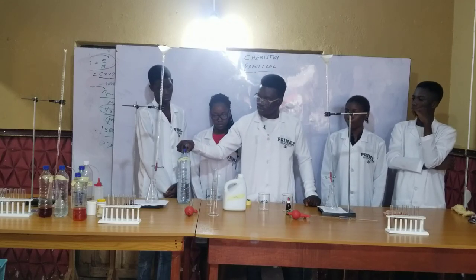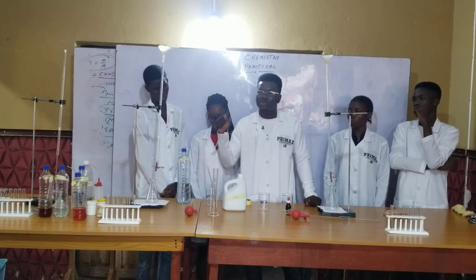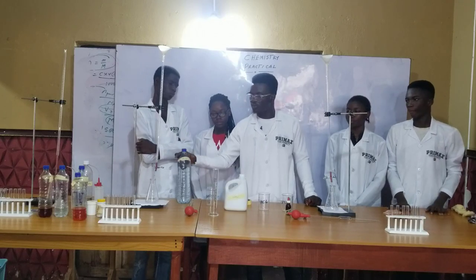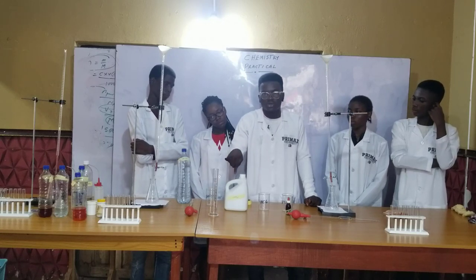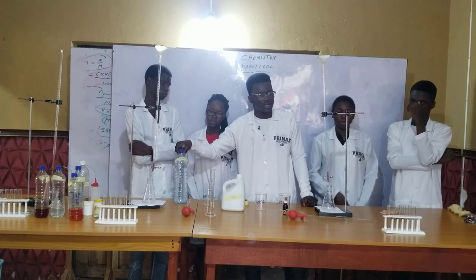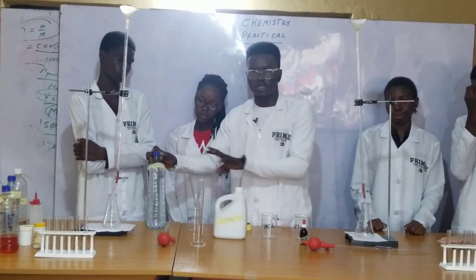For this one, we don't really know the concentration. From the titration, we will know a particular volume of this acid that will exactly neutralize a particular volume of the base. When we know the volume of the base, the volume of the acid, and the concentration of the base, we can calculate the concentration of the acid. So this is the known, and this is the unknown — we use the known to calculate the unknown.